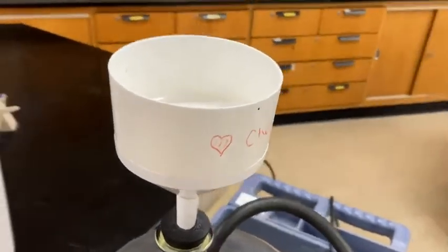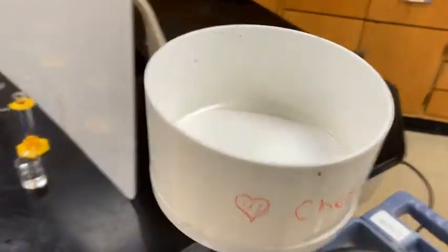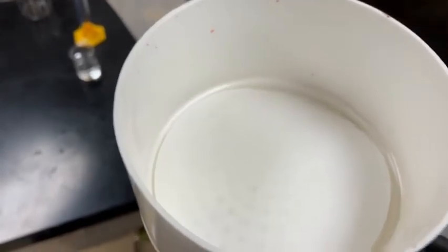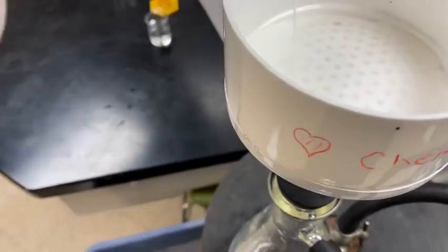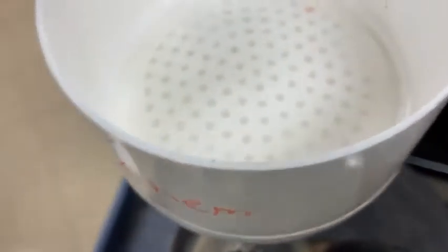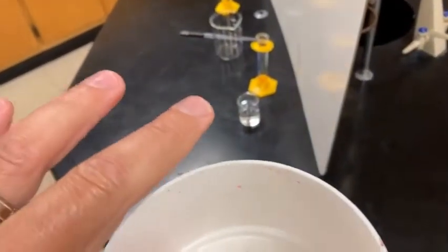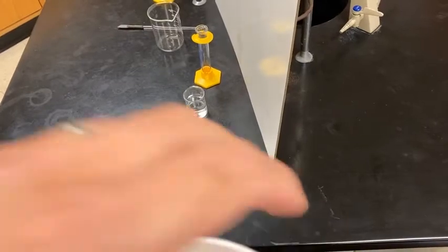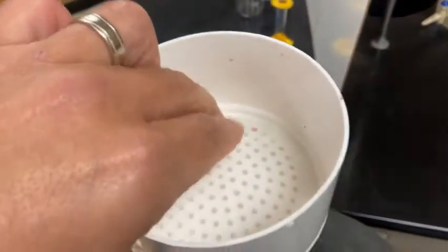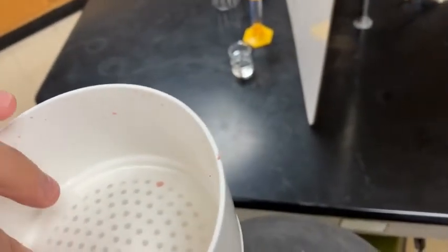All right, I've got the top of the Buchner funnel all set up. I've got the vacuum flask on, that's that noise. And one of the techniques that we want to do is, instead of just leaving that filter paper dry, we should actually squirt it with some distilled water, get it wet, and I'll show you what it's going to do here with that vacuum that's on. It should create a really nice seal. I'm going to push down in a couple places here. There we go. Get the sides all sealed in there so none of the precipitate that we're about to form escapes. That's a good sound, actually.